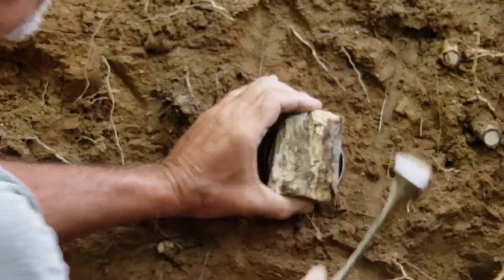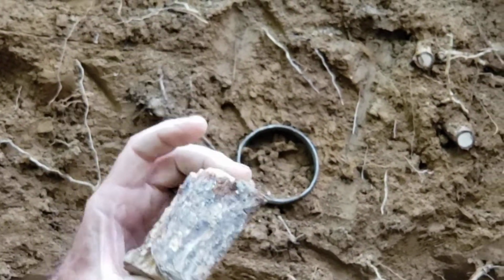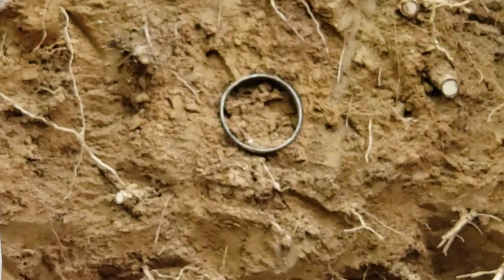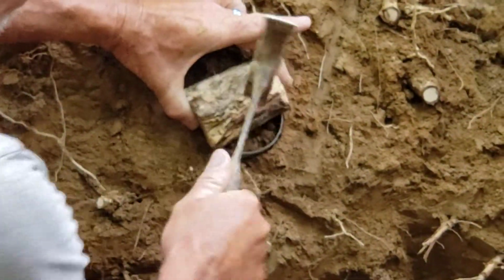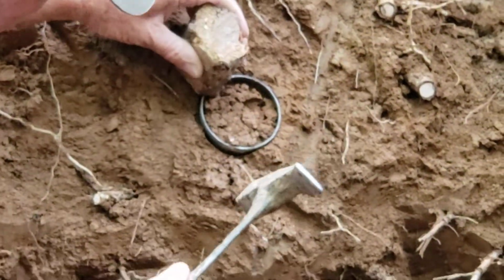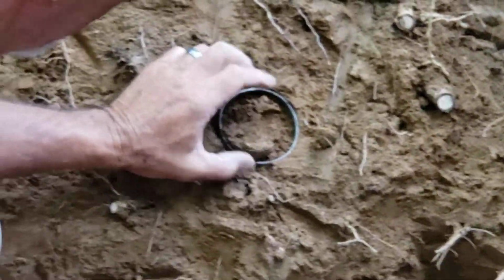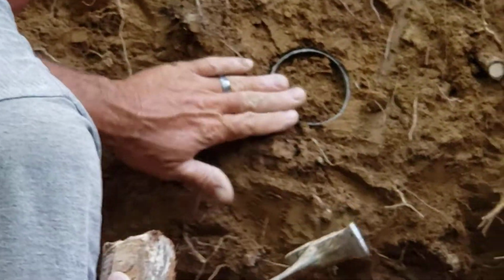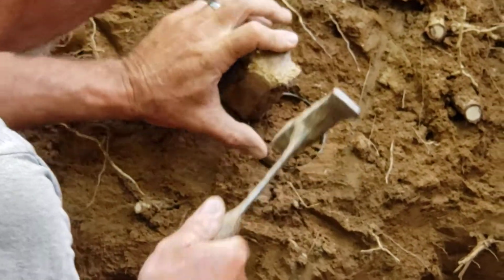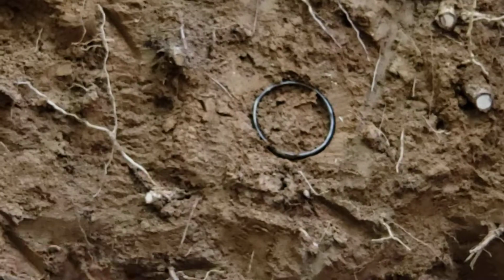You need to be careful that whenever you get close to the surface, you're not compacting that surface, because we're really after the bulk density of this material. So you get close to the surface, you start taking care that you're not compacting it. You can pound on the edge of the ring away from the soil, and you have to watch out because soil material falls out of the ring readily, and you don't want to pack that. Every time you hammer on it, material wants to fall out. So you need to get that nice and flush on that surface.